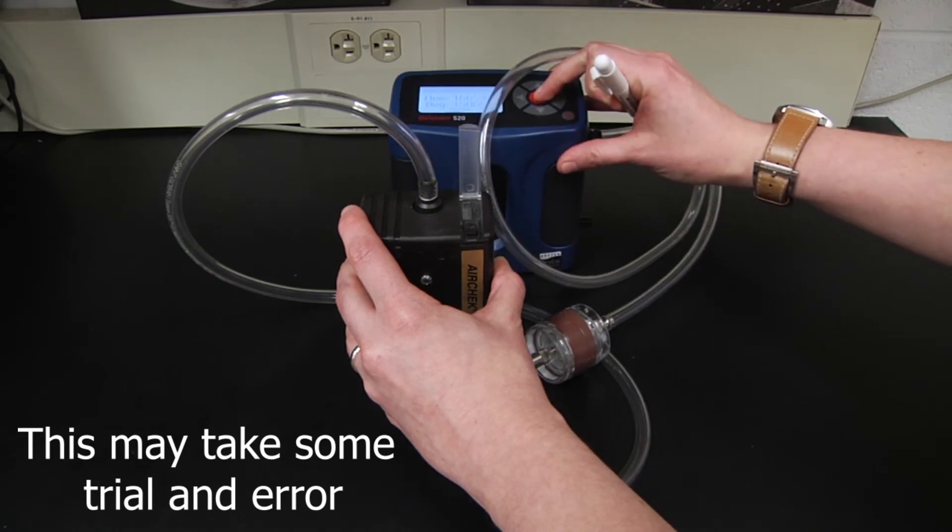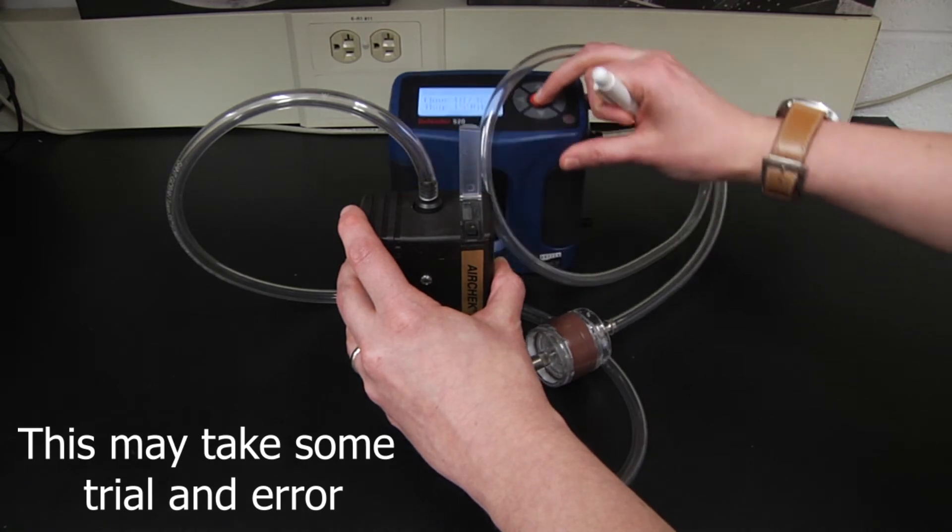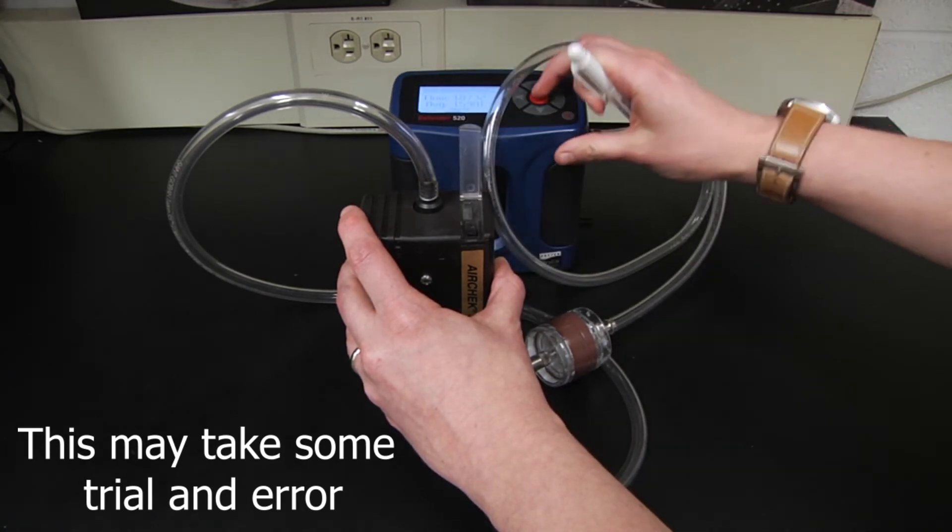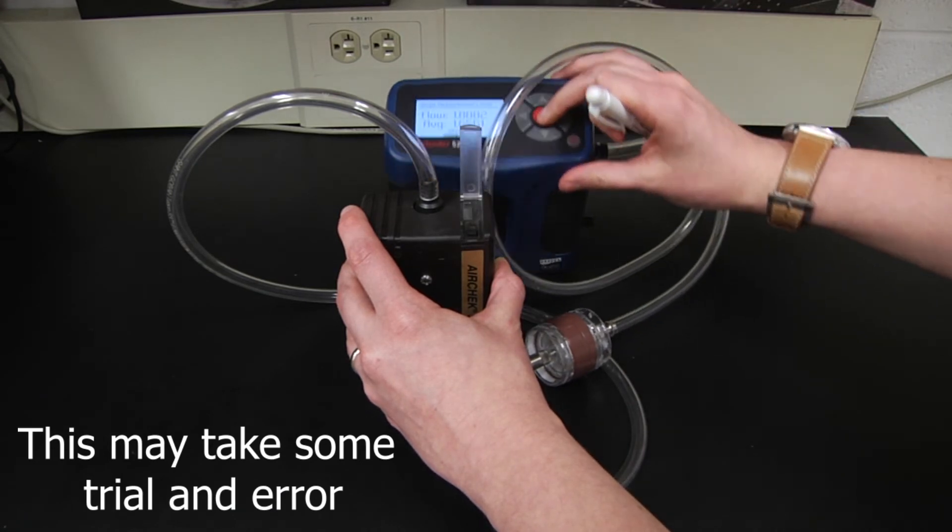While this flow rate will vary depending on the procedure, there are very specific flow rates for particle size selectors, such as cyclones, so always verify that you're operating within the approved range for the procedure.